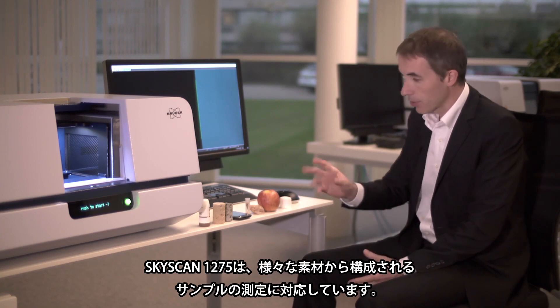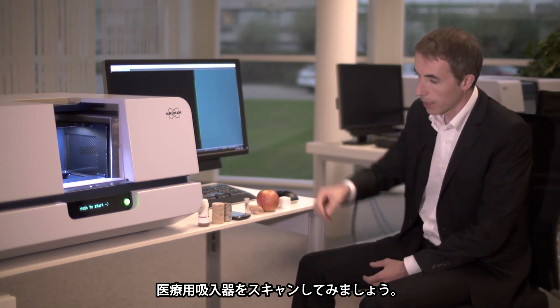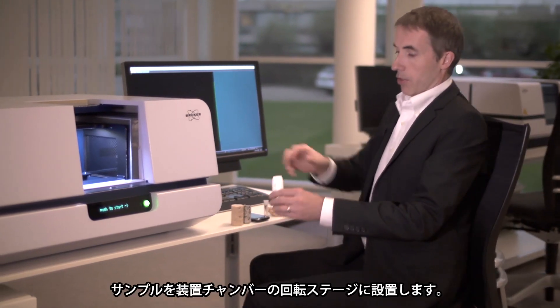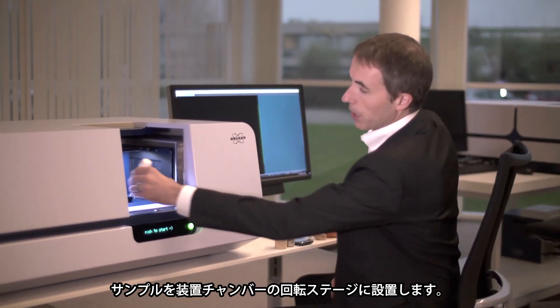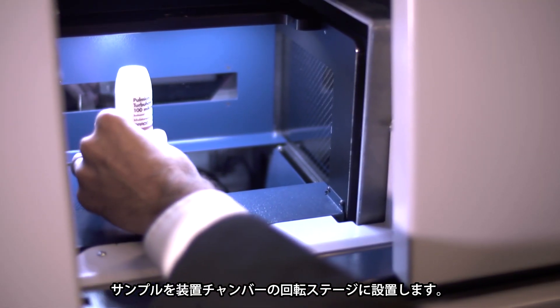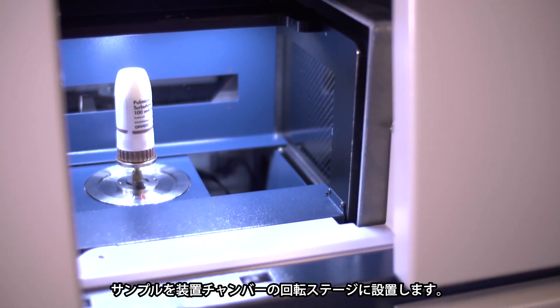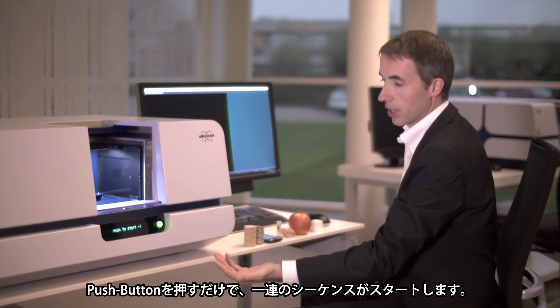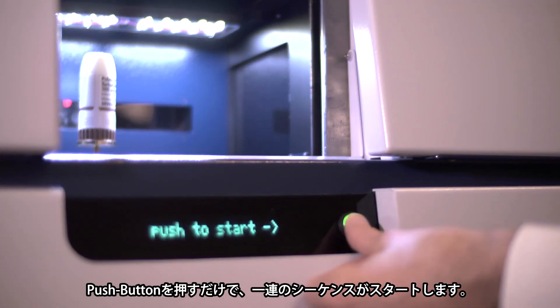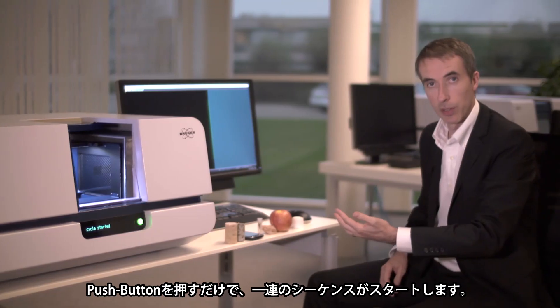I'll demonstrate this today by scanning the inhaler. We can simply place the sample in the device and by a single push of the button the entire process will start.